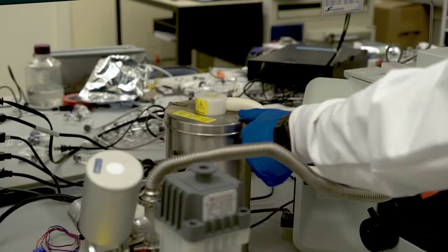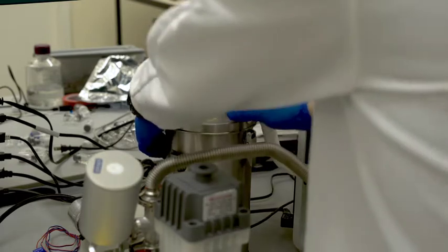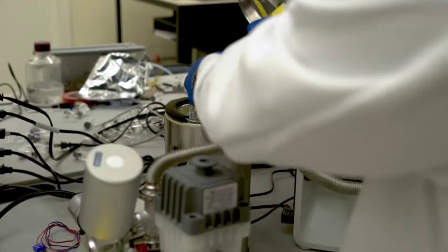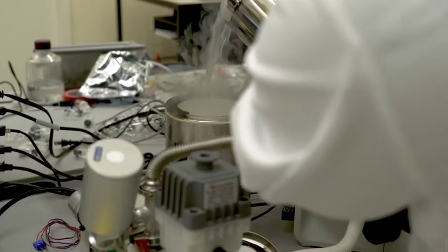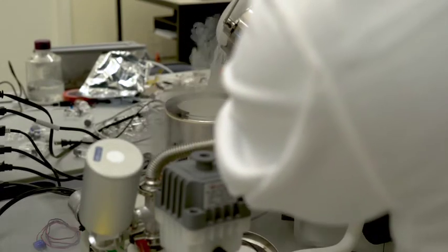Fill small cryogenic storage dewar with liquid nitrogen. Fill liquid nitrogen reservoir to about three-fourths full and replace lid.